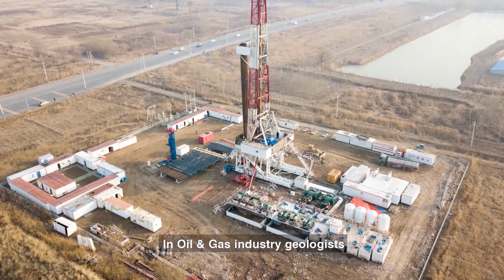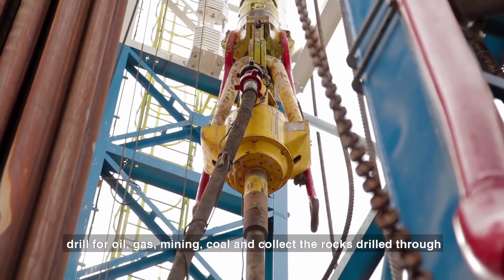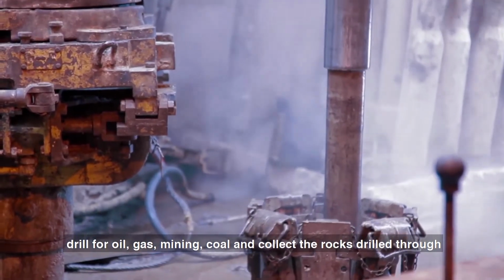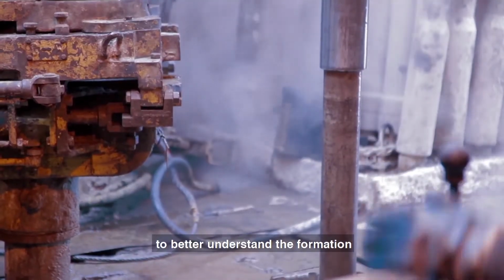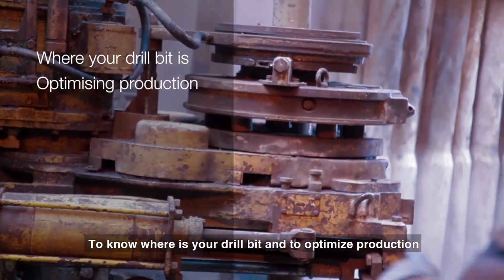In the oil and gas industry, geologists drill for oil, gas, mining, coal, and collect the rocks drilled through. When those rocks come back to the surface, we can look at the properties of the rocks to better understand the formation, to know where your drill bit is, and to optimize production.